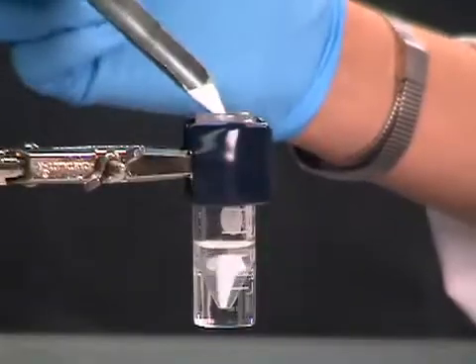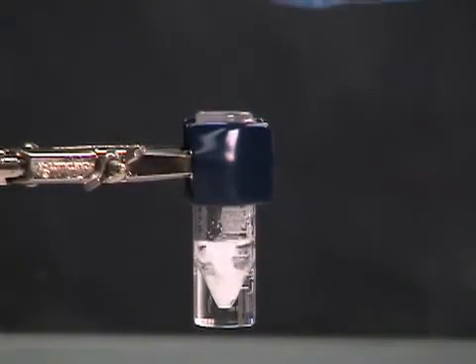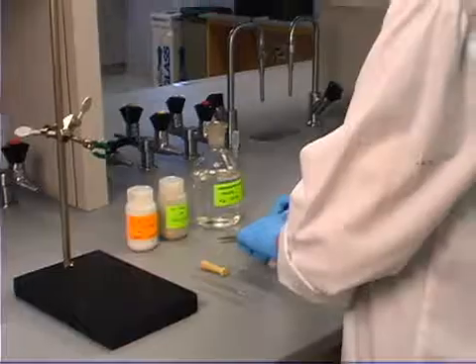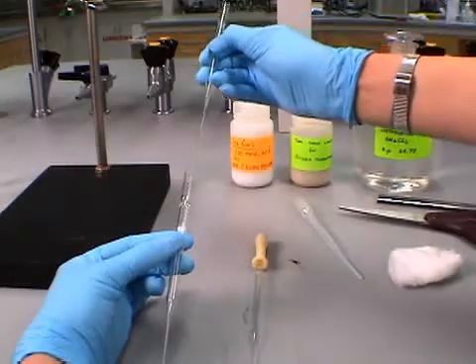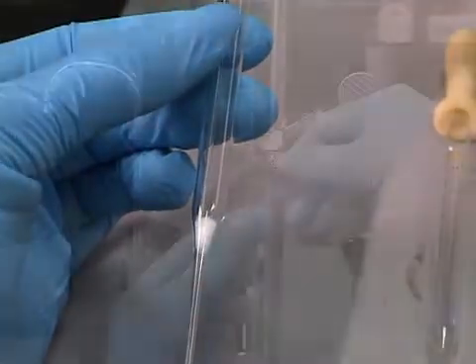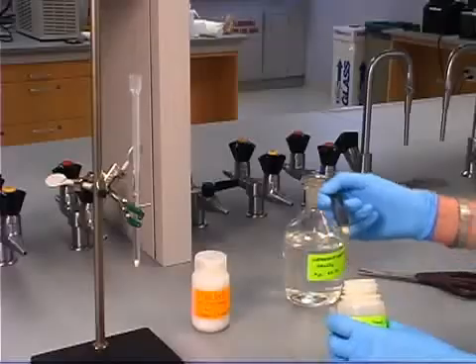Add a drying agent to remove any additional water. To purify the ester product, prepare a microcolumn using a Pasteur pipette. A cotton plug is inserted, and a funnel is made by cutting the bulb off a plastic transfer pipette.